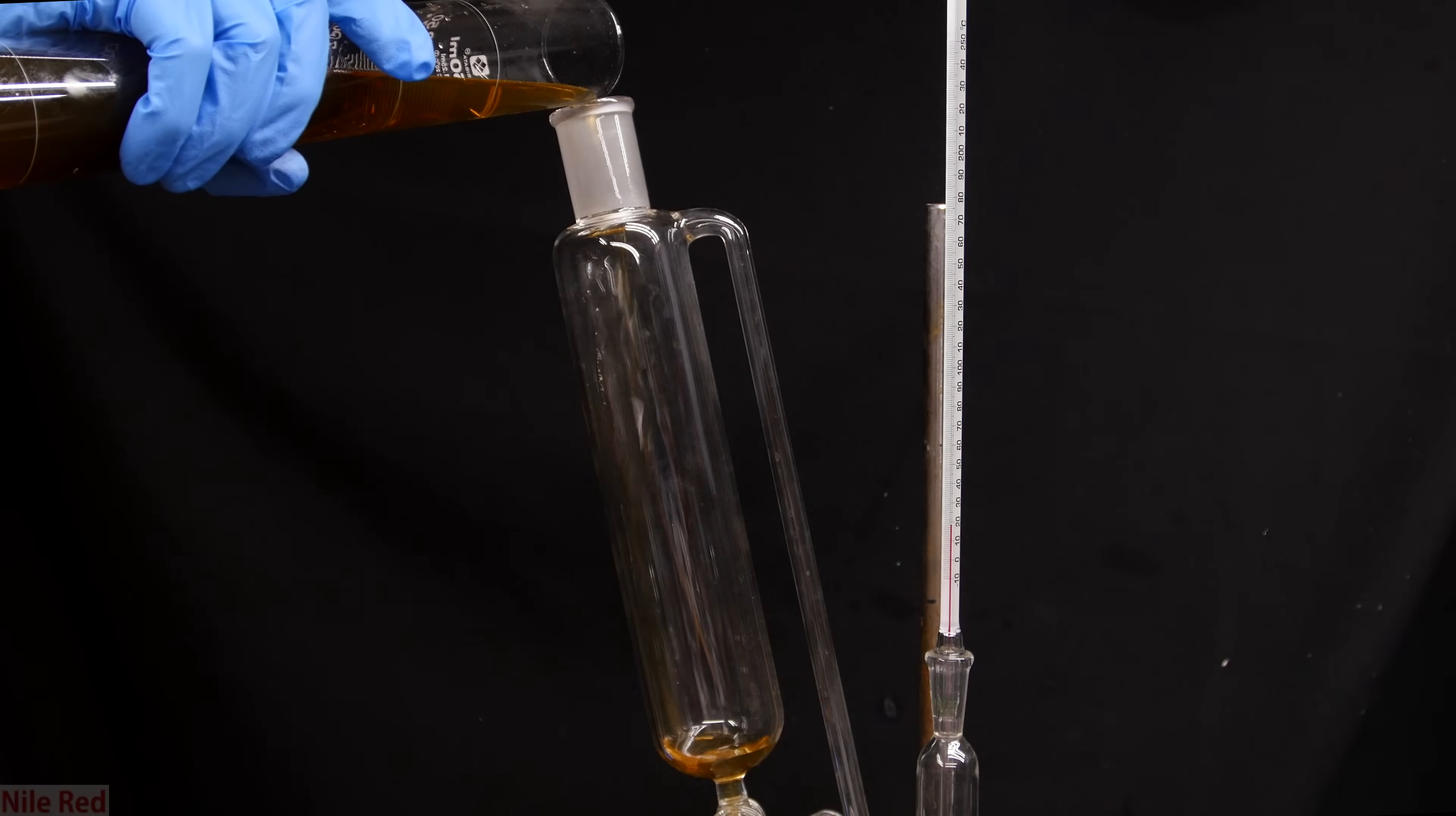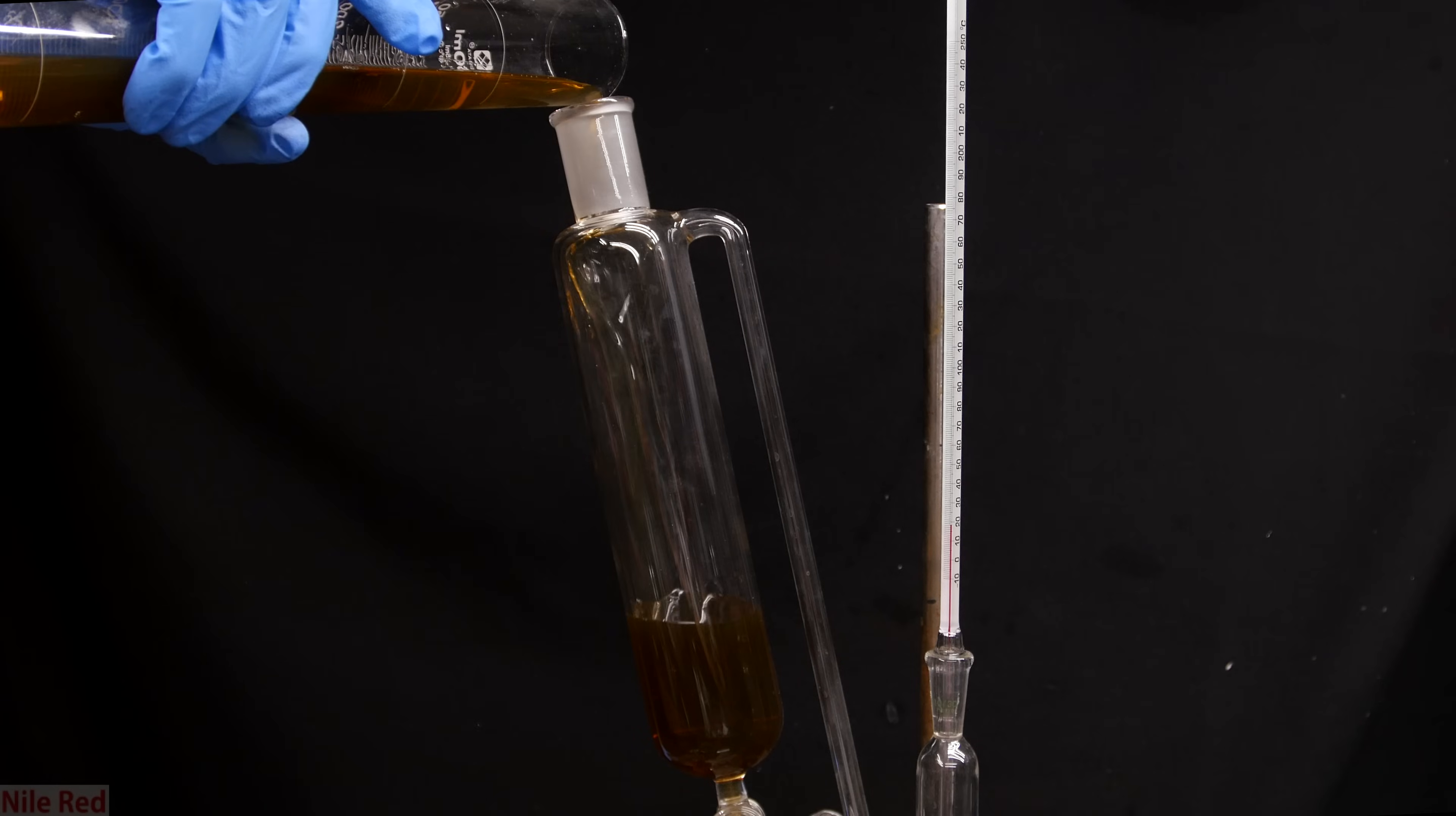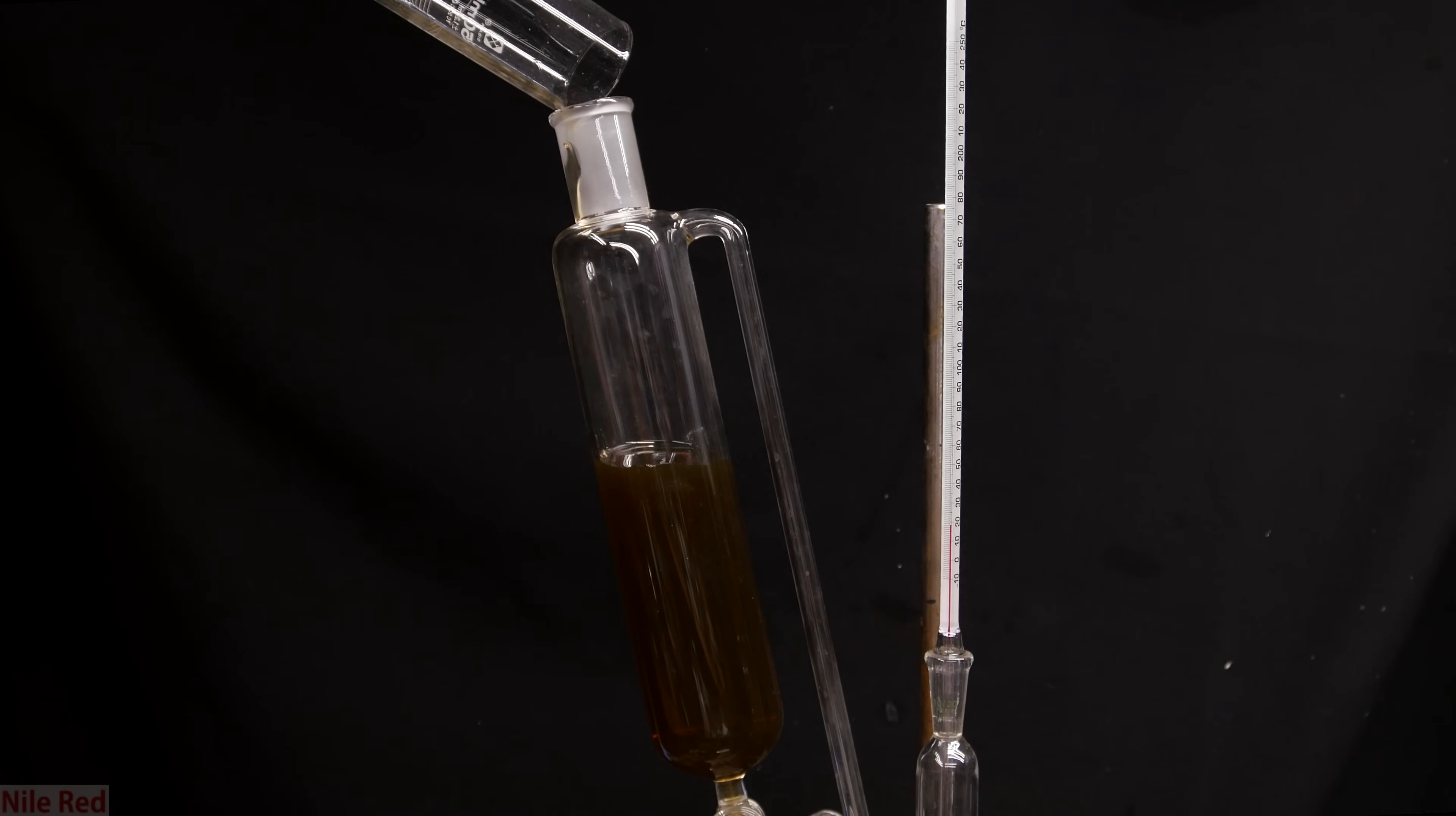Pure, clean sulfuric acid is colorless, but when you buy it as a drain cleaner, they have colorants and other things inside. For some reactions it will matter, and this is why in our previous video I showed how we can clean up the sulfuric acid drain cleaner, but for this reaction it really isn't an issue.